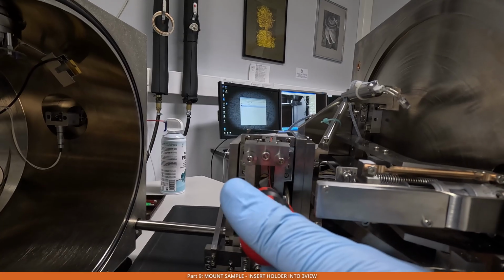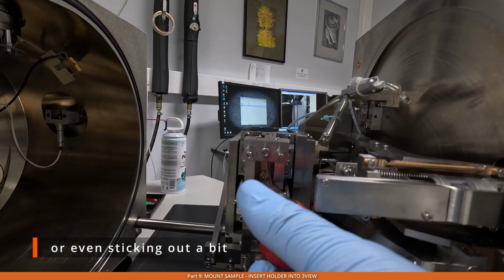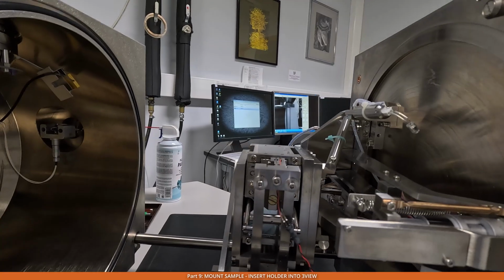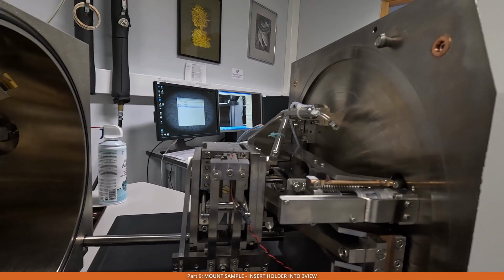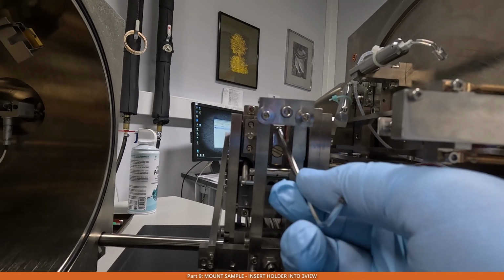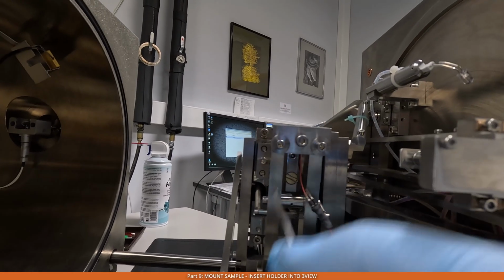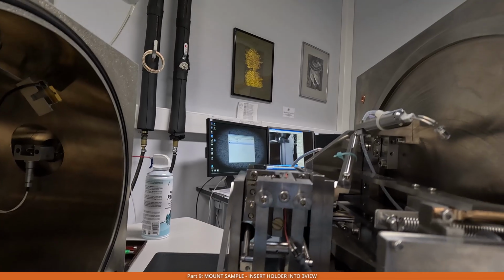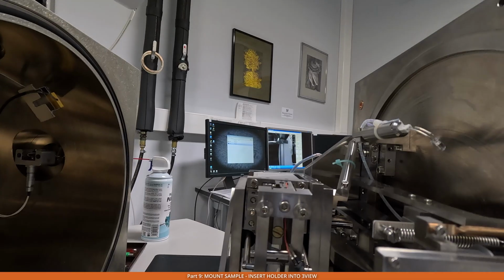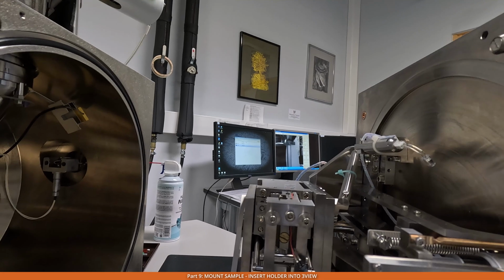So our goal again is just to make sure that we unscrew this one as much as possible until it reaches the level of the assembly. Next task is the screw here, hopefully you can see it, at this part, it's the screw that locks our holder with the sample in this assembly. What we need to do is tighten this, but before doing that, we'll put the stereo microscope on the door to make sure that it's in the correct position.